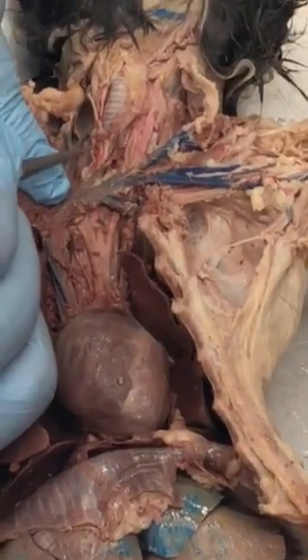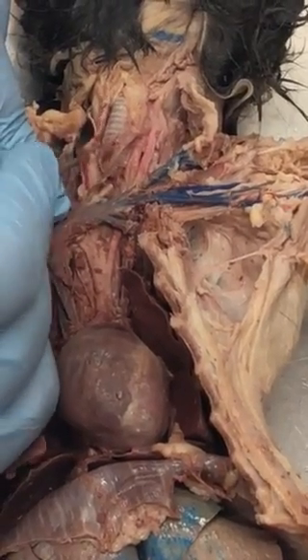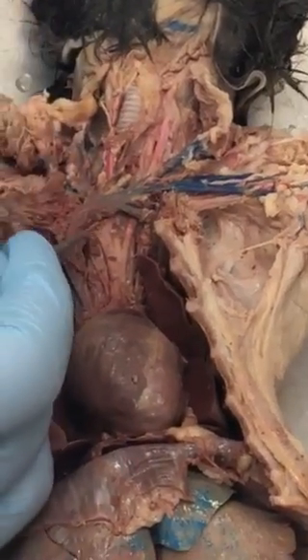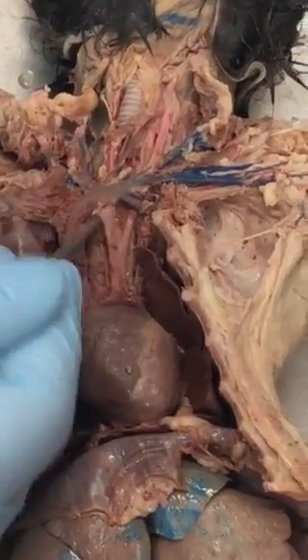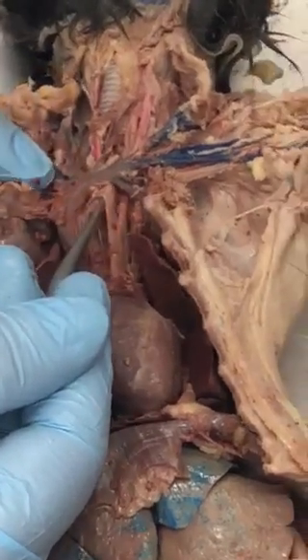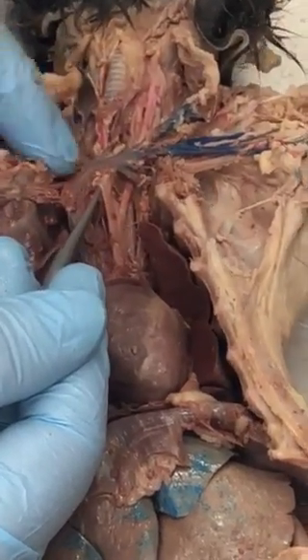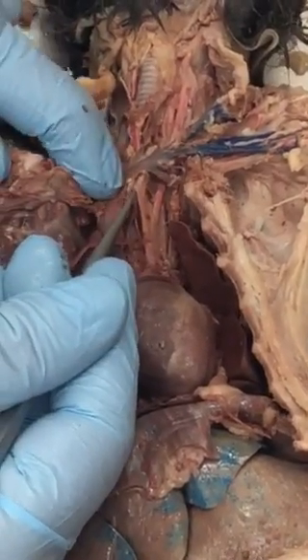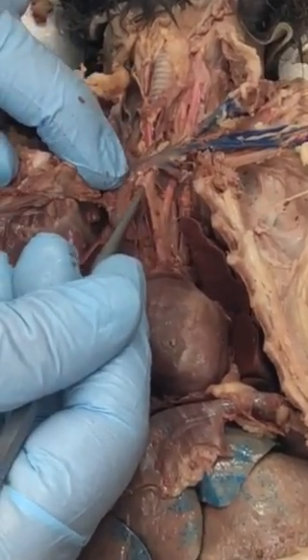You can see those much better up here. There's a left common carotid, right common carotid there, and then this third branch right there which disappears here and we don't have that dissected out. That's the right subclavian.